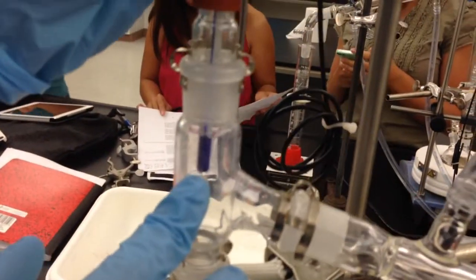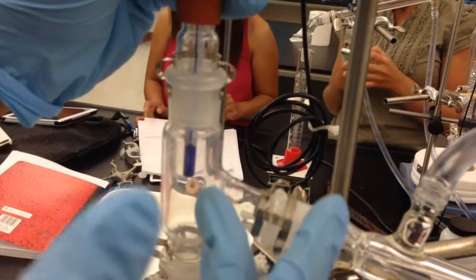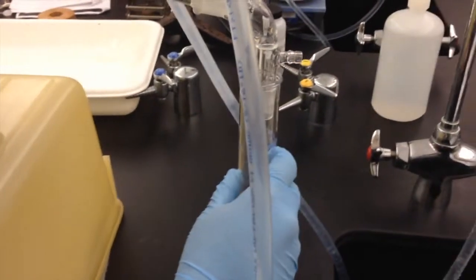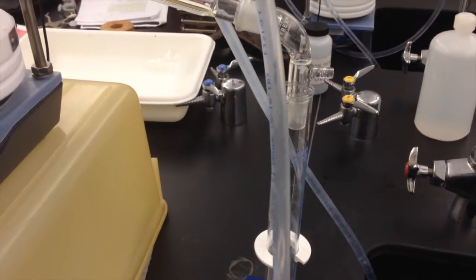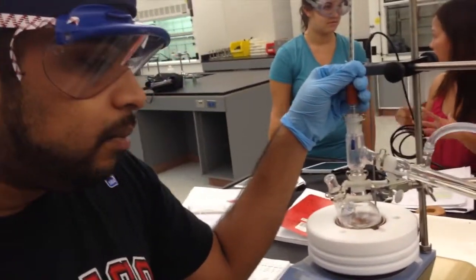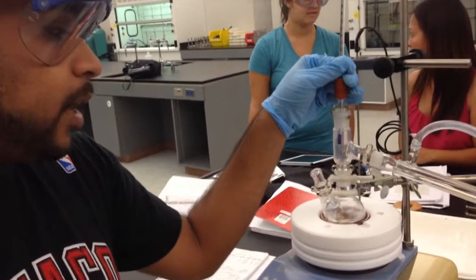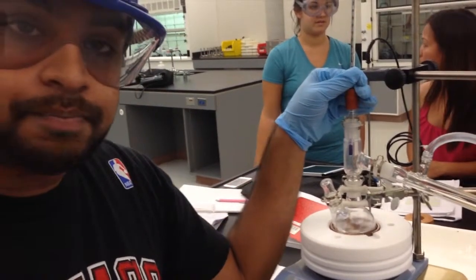The reason you want to do that is so you know the accurate temperature of the vapors as they come through the round bottom flask. Now, once it collects in here and goes down the collection tube, we'll collect the first 3 samples and put them in a vial, and from there we'll be able to run the GC on it and see what the actual concentration of cyclohexane is that we got. Once we do that, we'll keep collecting to see exactly how much volume of cyclohexane we collect, and then when we measure from there, we'll be able to know the theoretical plates, or the efficiency, of our system.